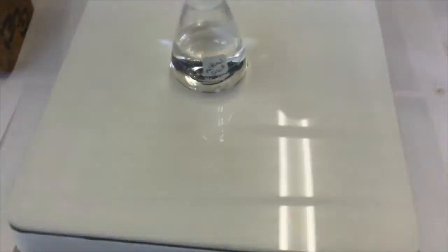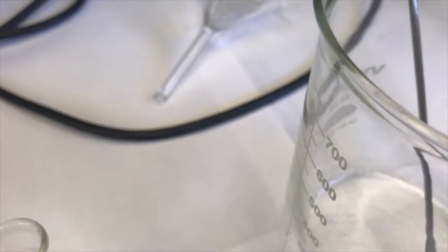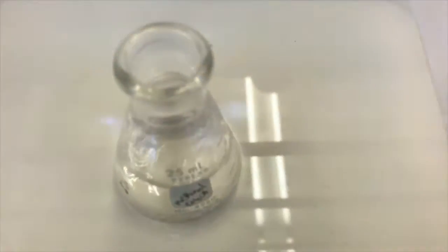Once my methanol is boiling, you'll watch me pipette some of that methanol first into the beaker to dissolve the residual solid there, and then pipette it over into my Erlenmeyer flask. And once I've got the bottom of the Erlenmeyer flask coated with that methanol, I'll put it up here to keep it hot, and I'll continually add hot methanol.